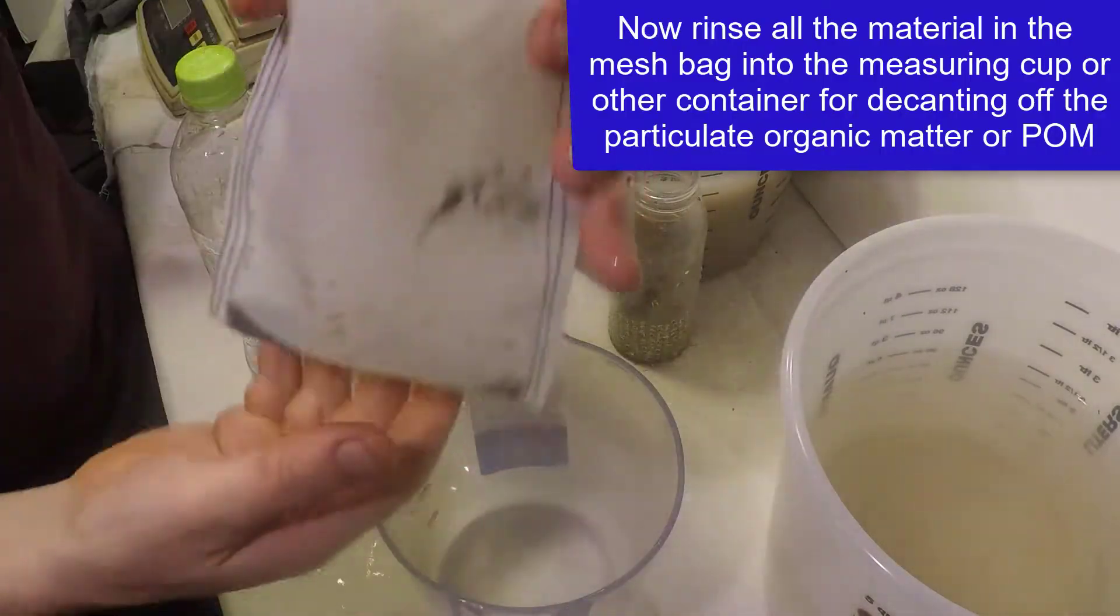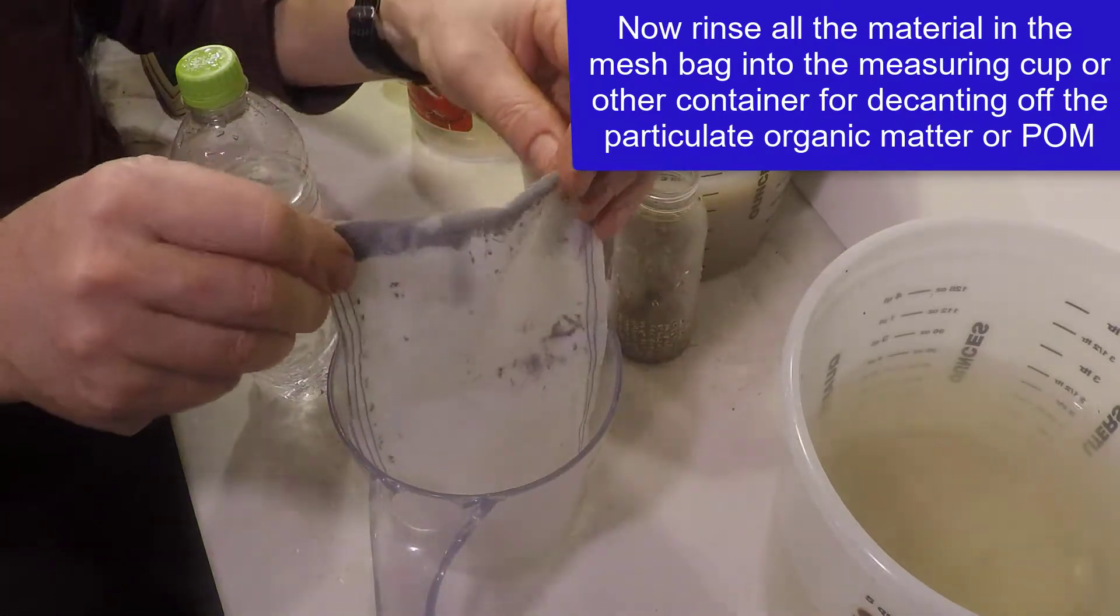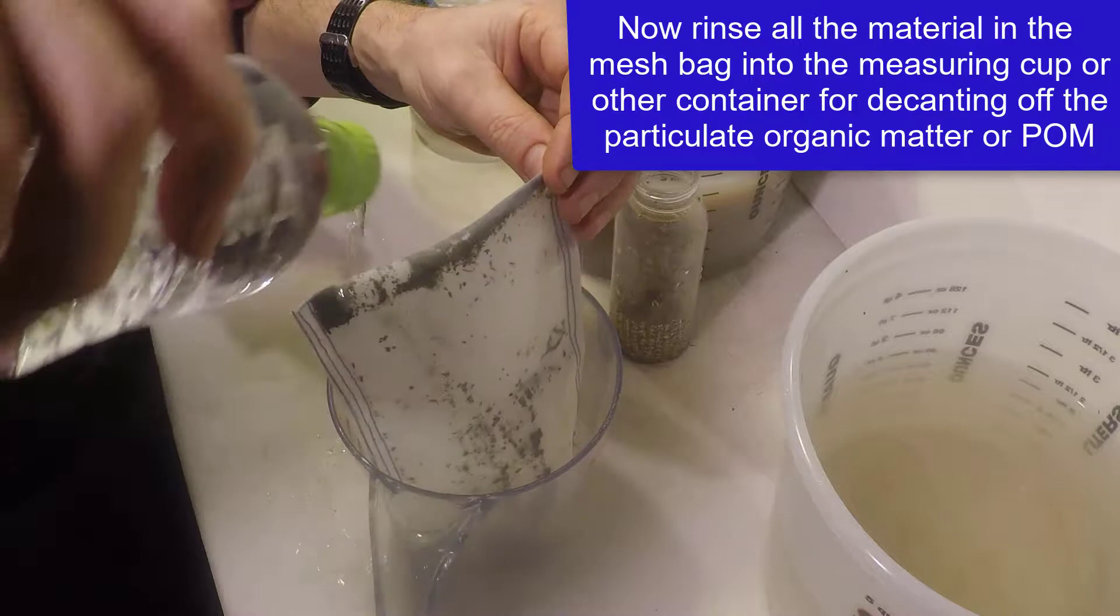Next, rinse the contents of the mesh bag into a measuring cup or other open-topped container that will allow pouring off the water and organic matter.